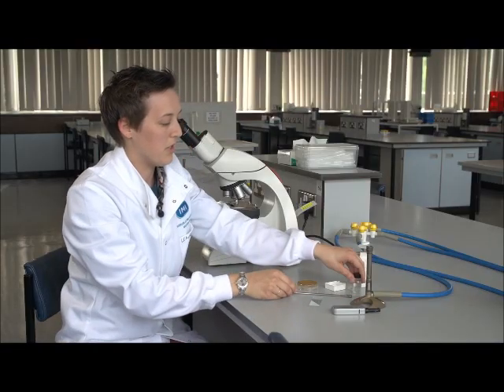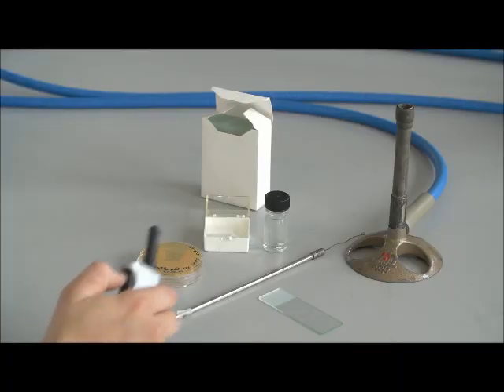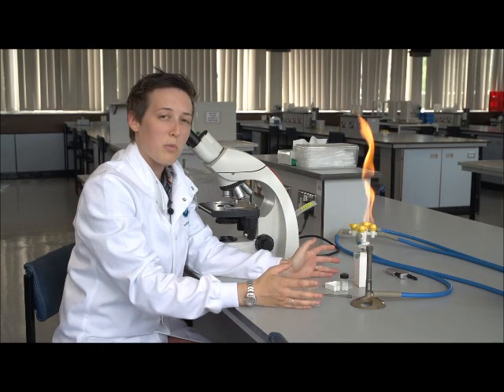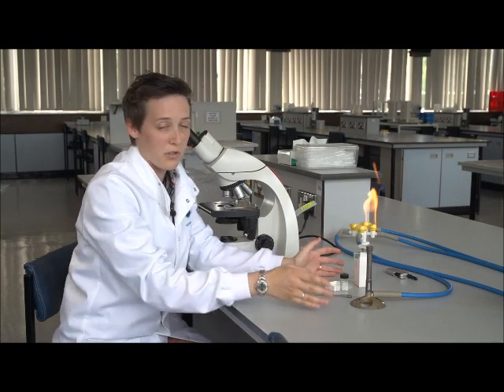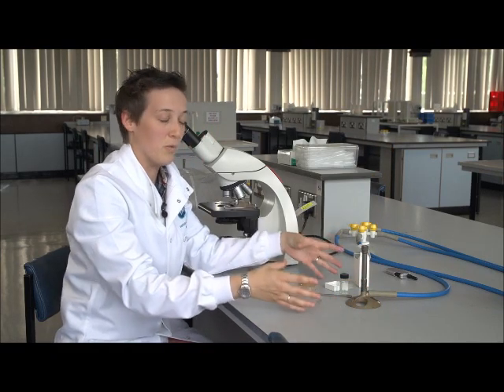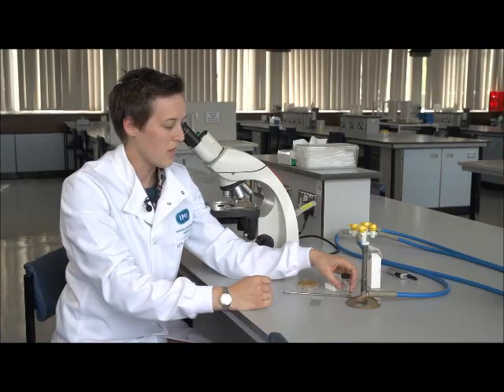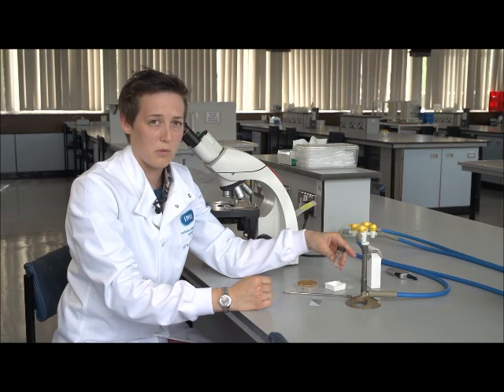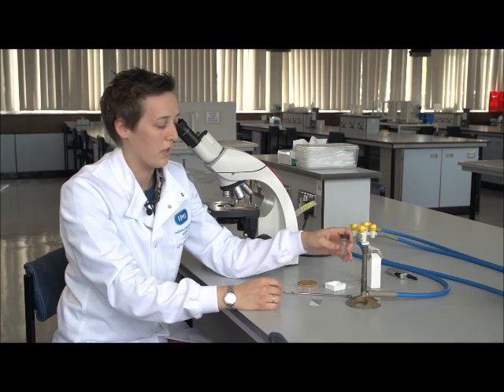So the first thing that we need to do is light the Bunsen. And remember that while we're working in an aseptic manner, we need to have the Bunsen on blue flame. And then we need to work as close to it as possible. So what we need to do first is provide some media for our sample on the slide, and I'm just going to put a few drops of sterile distilled water on here.